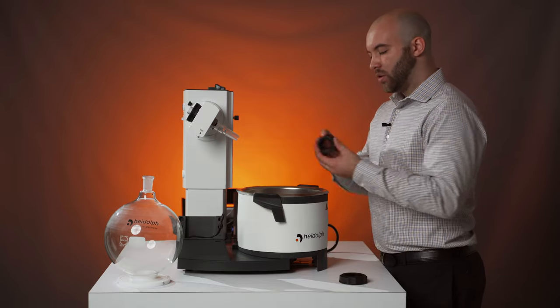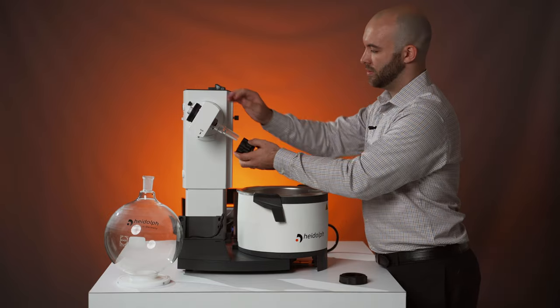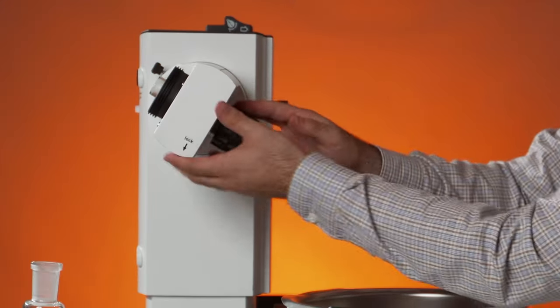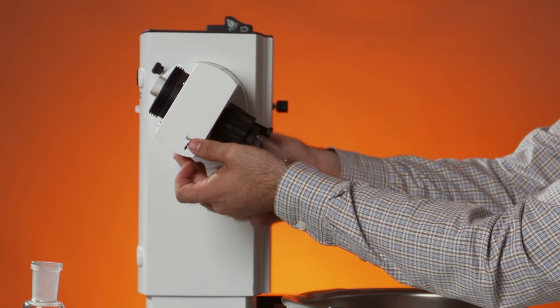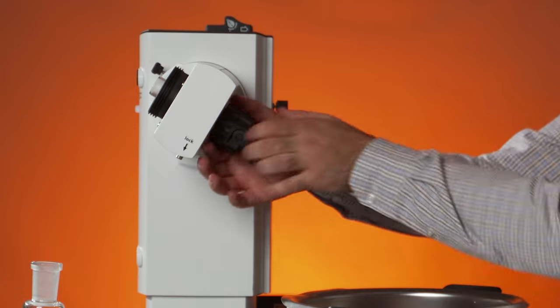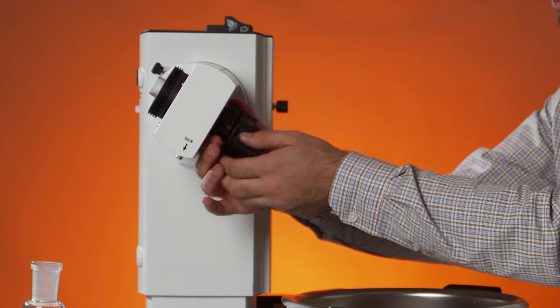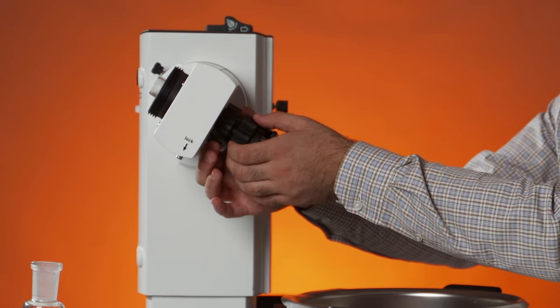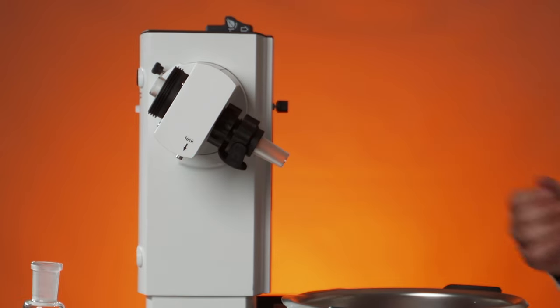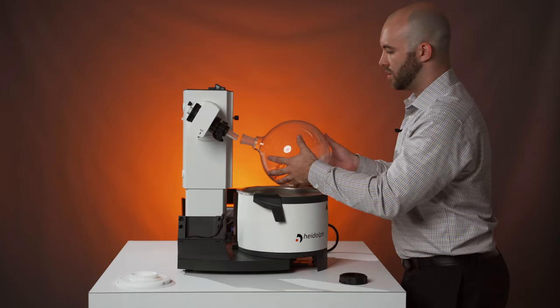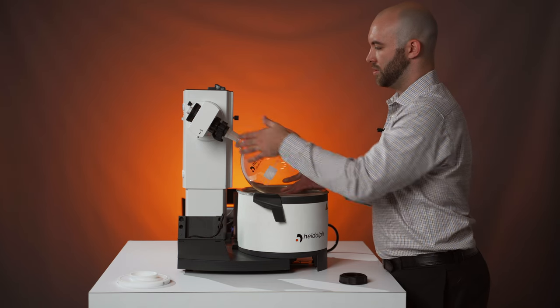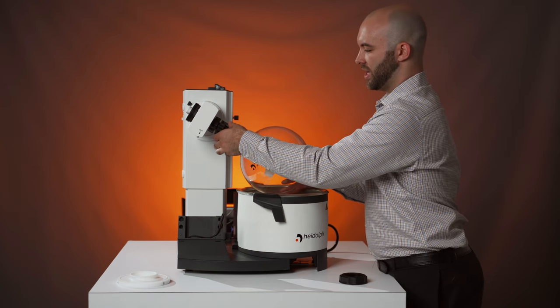After that, we can add back on the easy clip by holding this lock button and then unscrew the clip portion of this two-piece device. Open up the swing and grab your evaporating flask, slide it over your vapor tube, flip down and tighten.